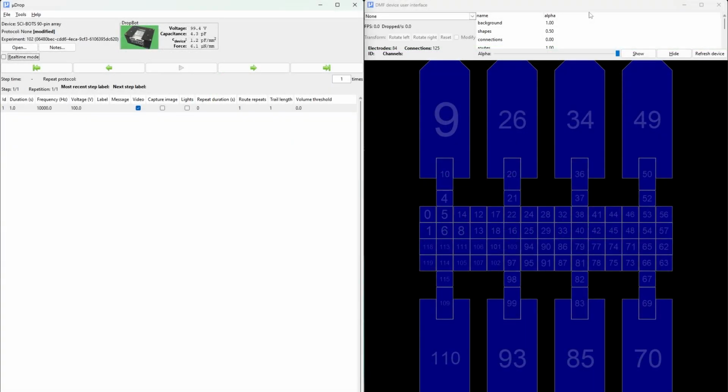Begin by launching the MicroDrop application on your computer and connecting your DropBot via USB. Next, click the Tools button in the top left corner of the MicroDrop interface. A drop-down menu will appear. Hover over DropBot to reveal additional options. Here, you can choose to run either all tests or a specific one. For this tutorial, we will select Run All Onboard Self-Tests.